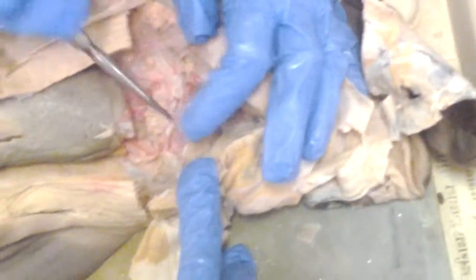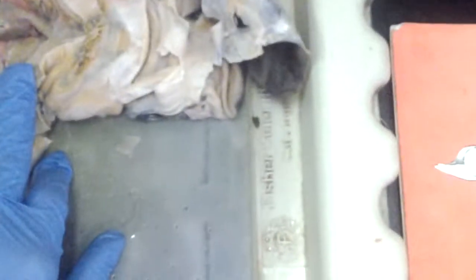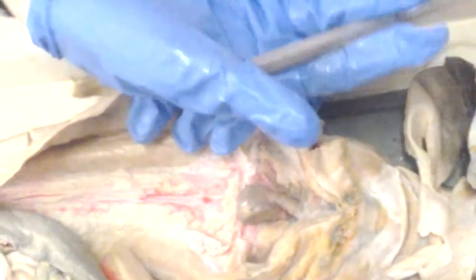Now unfortunately it looks like your sinus venosus is pretty much missing here. Should we get another? Yeah, we can look at somebody else's, but first, let's see what else we can see here. This is still the ventral aorta or dorsal? This is dorsal aorta. Now the ventral aorta is only in the ventral side of the mouth. So to see it, you have to open the mouth. Okay, so when we go into yours, my specimen.